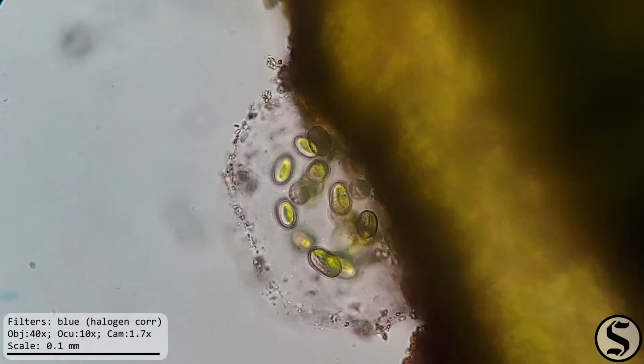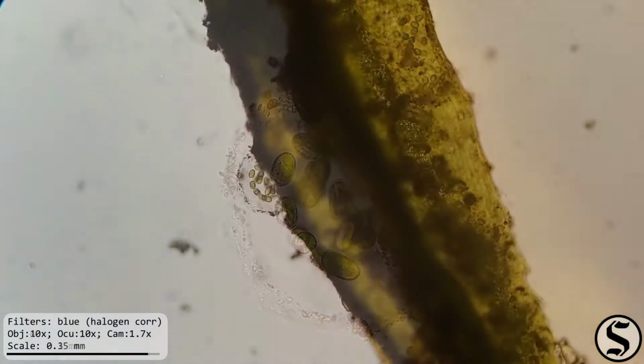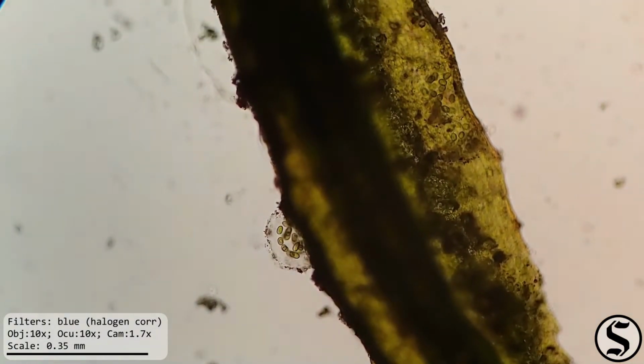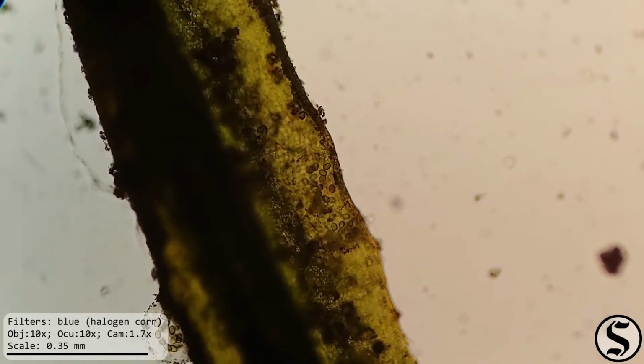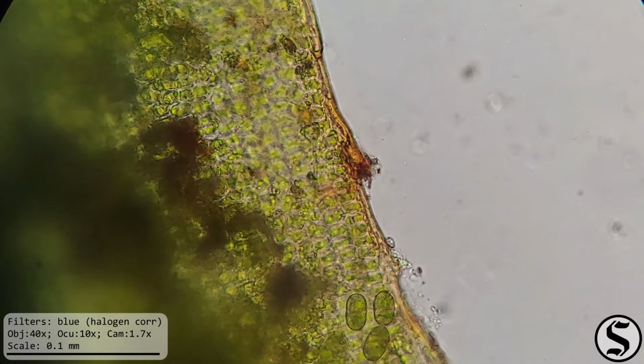But in any case, it seems to be growing on this moss leaf and looks really interesting. Those green cells are just suspended in there. And we can see that it actually looks like maybe this leaf is full of them. Here you can see them through the leaf. Due to the depth of focus at these magnifications, we can really change what level of the image we're looking at by changing the focus.